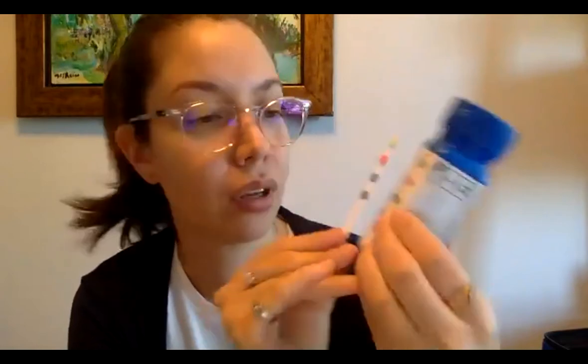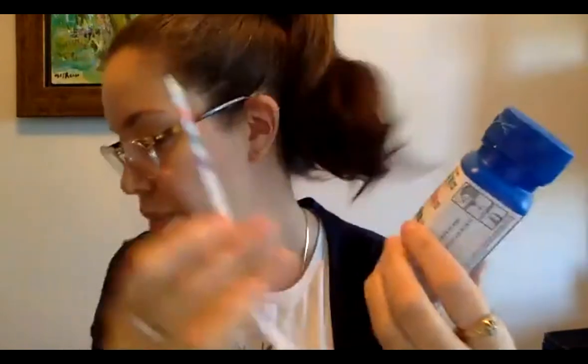So we always say start from the beginning. Clearly you can see that I'm about here, so I would just write down my value of 120. And then for my hardness, same thing. I'm pretty close to this value of 100. So all these values are pretty normal. There's nothing to worry about.